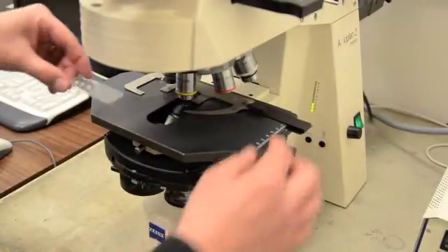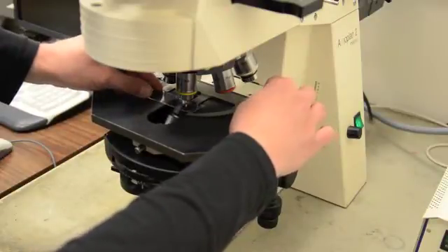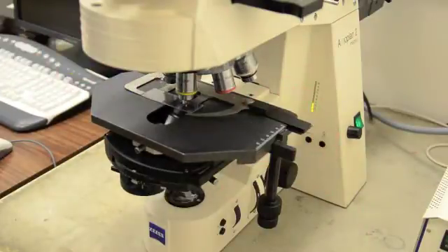Next, add a slide to the stage so that you have a subject to focus on. Focus in on your sample with the lens of choice.